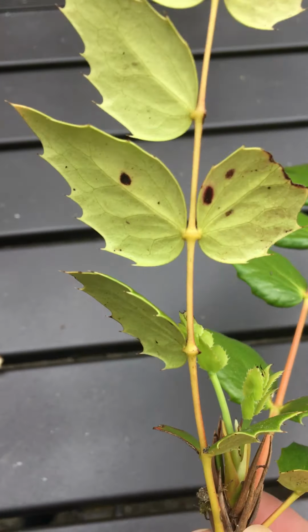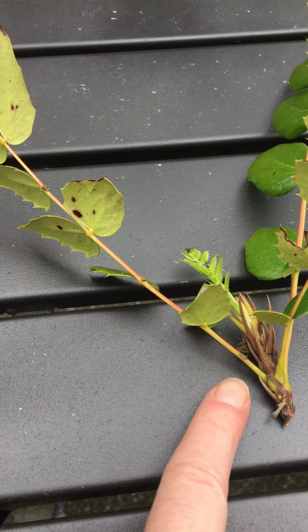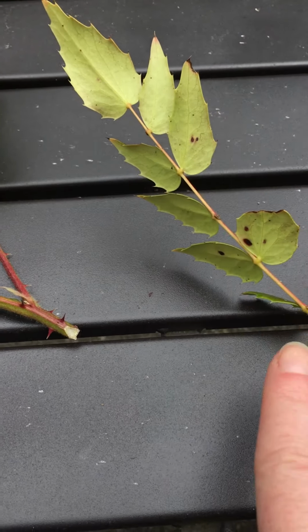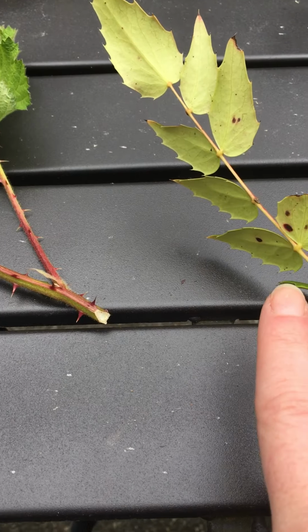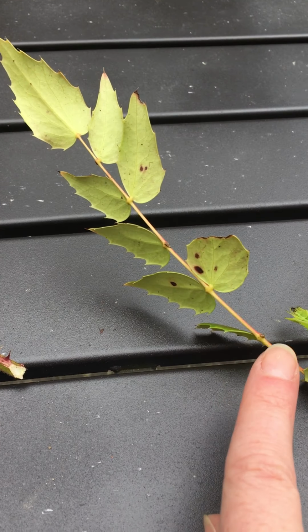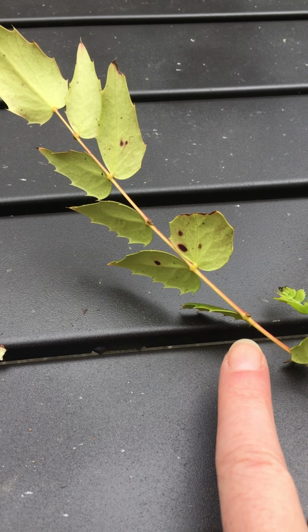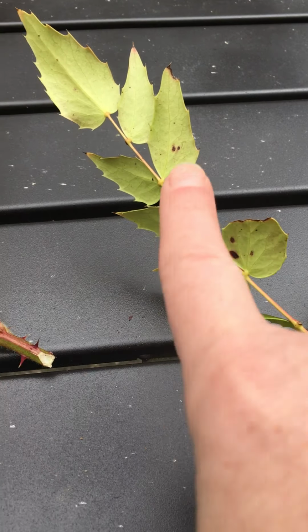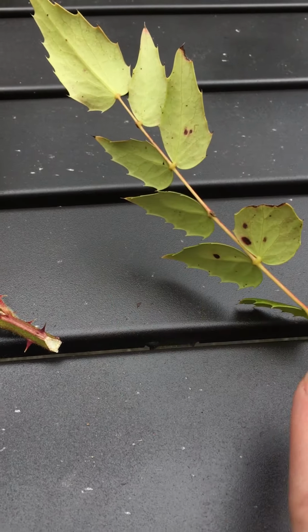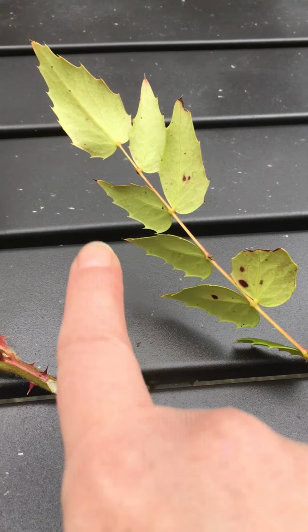So this is all one leaf, and you can tell because of where the bud is. So the bud is down here on the stem. This is the petiole, and all of this is the leaf, but it's divided up into leaflets. And this one would be in a pinnate arrangement on opposite sides of the mid-vein or mid-rachis of the leaf, like the sides of a feather, sort of a feather shape, like a fern also. So pinnately compound.